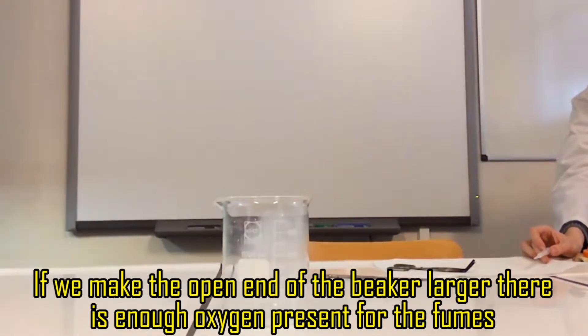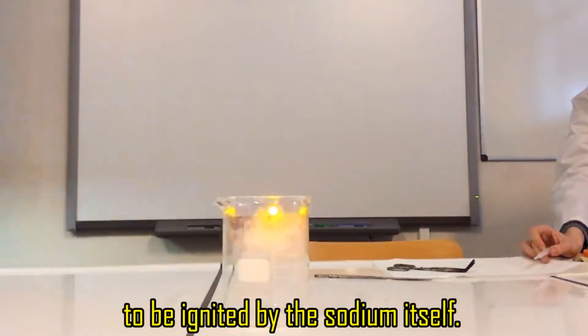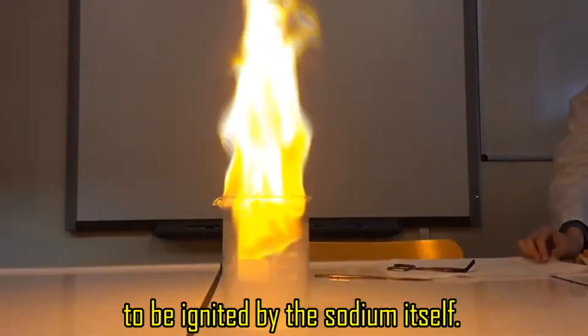If we make the open end of the beaker larger there is enough oxygen present for the fumes to be ignited by the sodium itself.